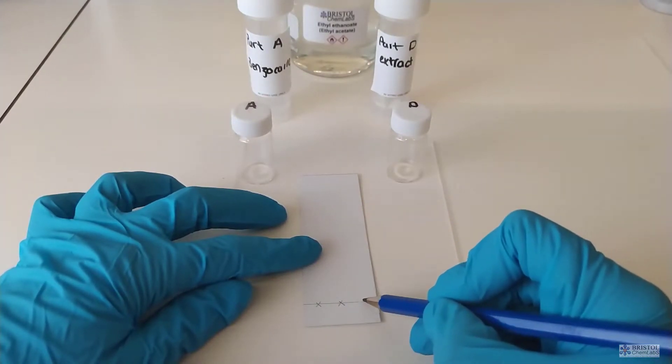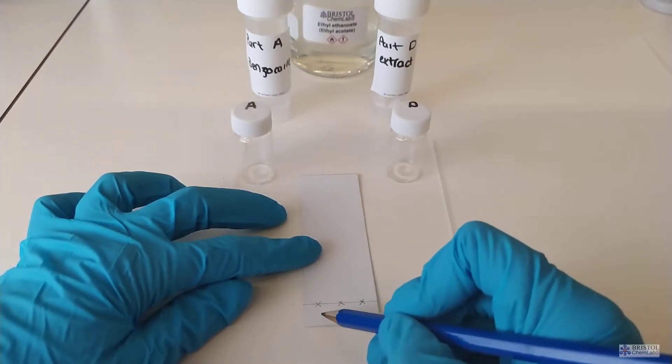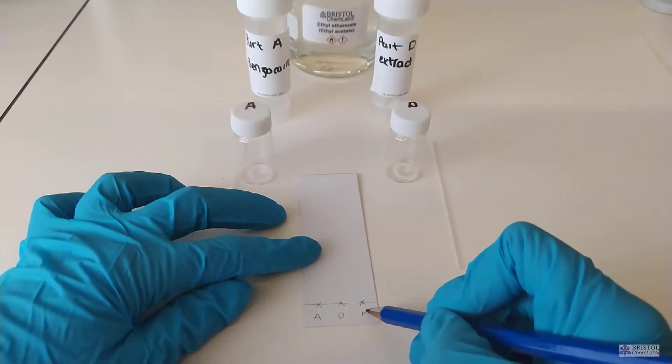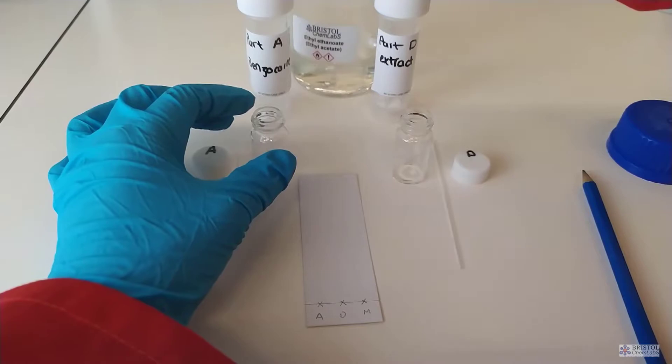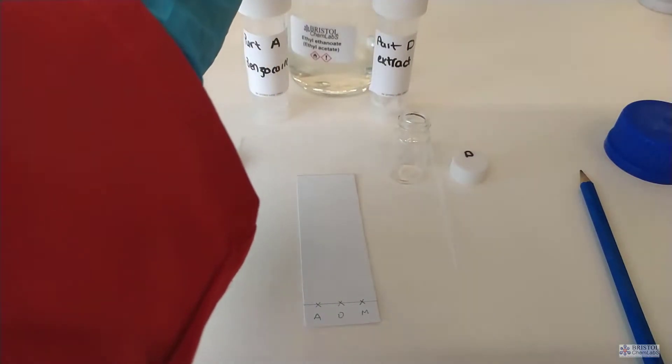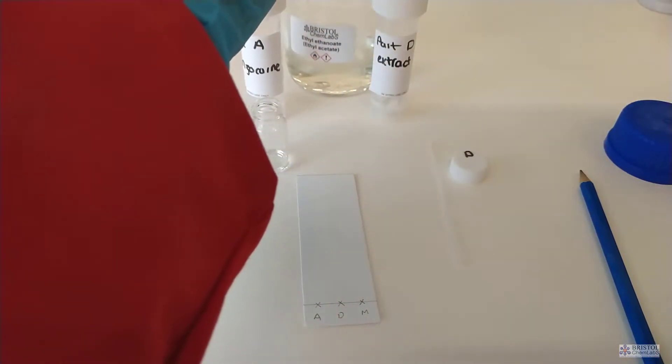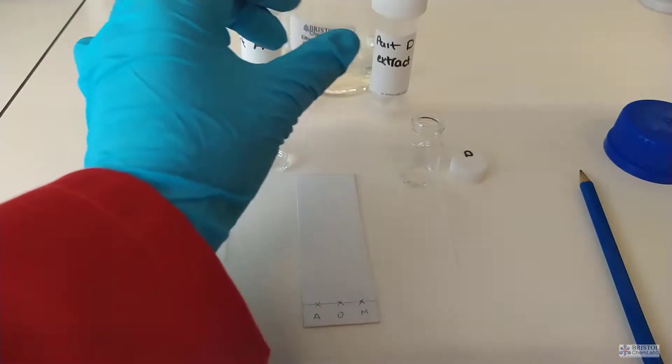When handling a TLC plate it's best to hold it by its edges so you don't transfer any contaminants to the face. To mark up a TLC plate, pencil not ink pen must be used. Draw a straight line to mark the position where you're going to apply the samples under test.